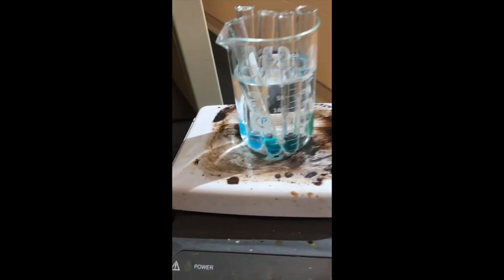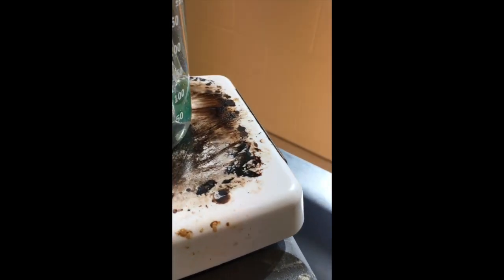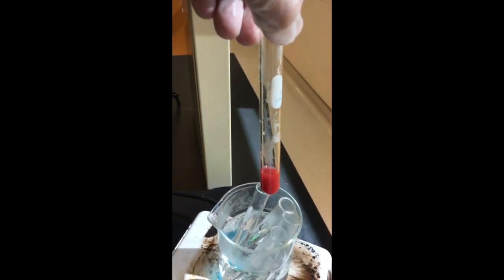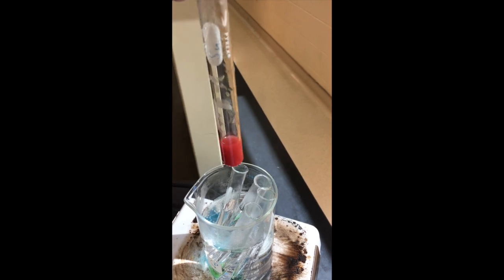I have put the glucose here in this center front part right here. That one's the glucose. It's in there, it's getting warm. We'll see what it does and whether or not the indicator works. All right, guys, so look. It's orange, it's simple sugar in the glucose. The glucose is simple sugar.